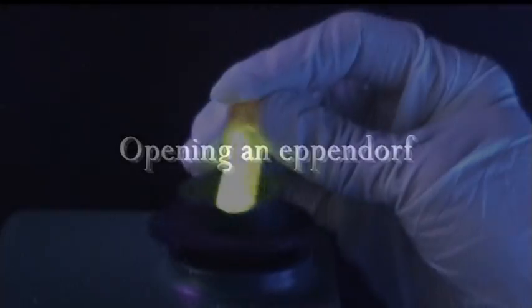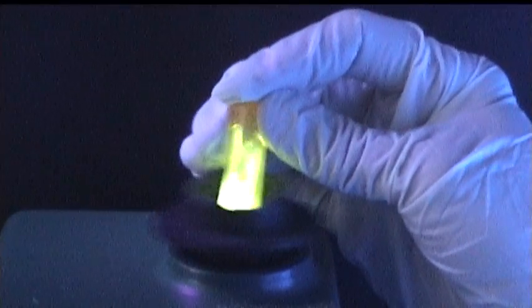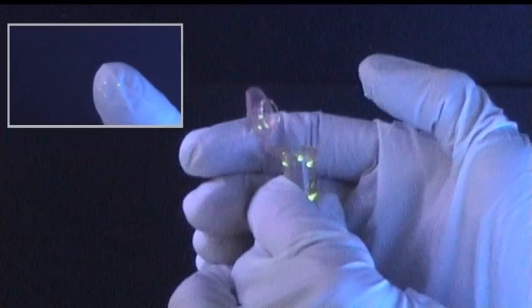Therefore, when vortexing tubes, always remember to use tightly capped tubes. In addition, it is important to remember that droplets can be present in the lid, which may easily be released when the tube is opened.